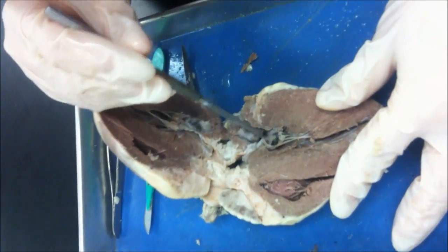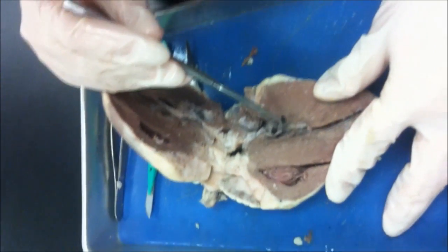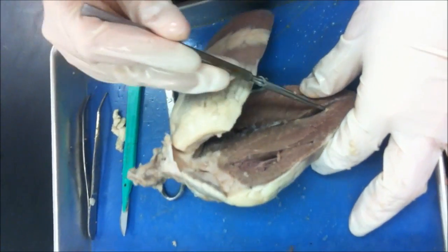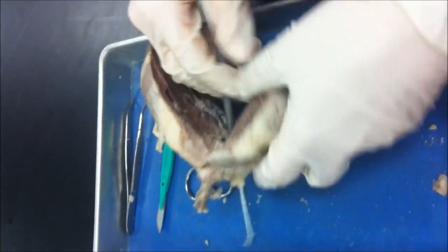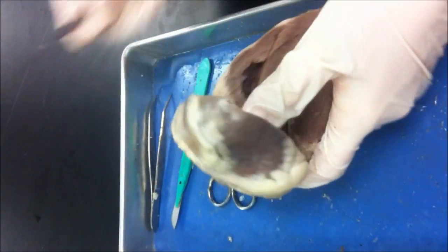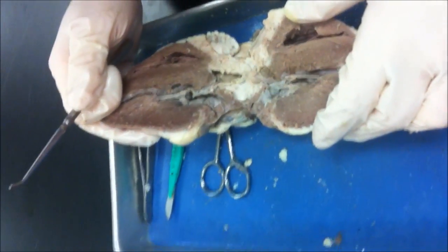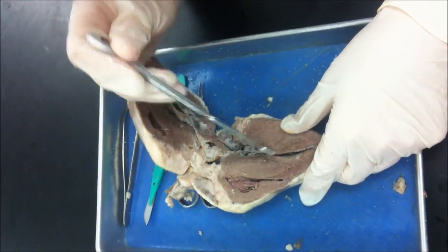Once the chamber is full, it goes through the mitral valve, and the mitral valve is connected to the heart wall with chordae tendineae, and it flows into the left ventricle, which then pumps blood through the aorta and out into the body. And because it's high in oxygen, it gives the blood lots of oxygen and nutrients and keeps the cells alive. This is the interventricular septum, which separates the right ventricle from the left ventricle.